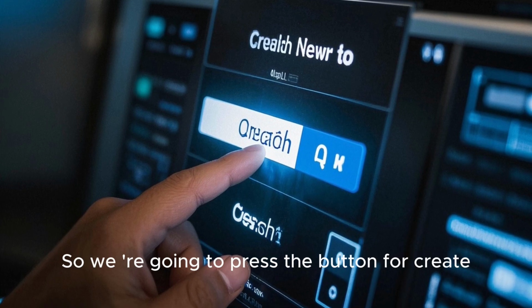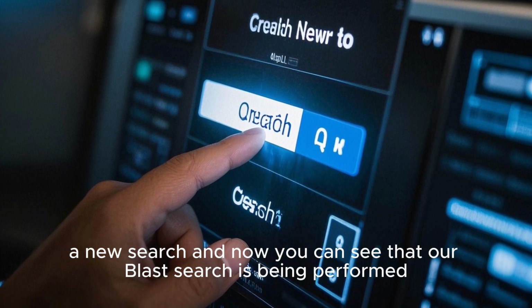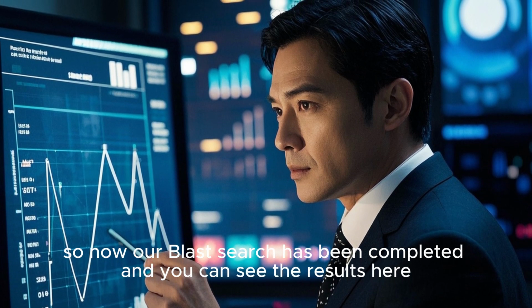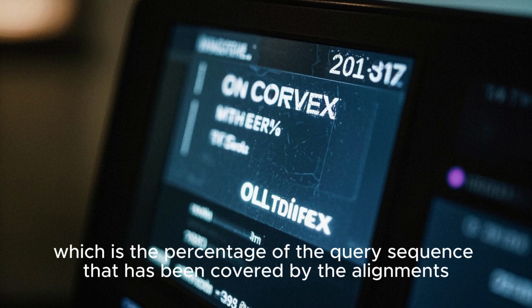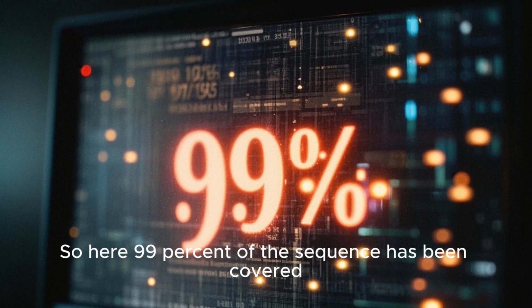So we're going to press the button for Create a New Search, and now you can see that our BLAST search is being performed. Okay, so now our BLAST search has been completed, and you can see the results here. The first thing that you will notice is the query cover, which is the percentage of the query sequence that has been covered by the alignments. So here, 99% of the sequence has been covered.